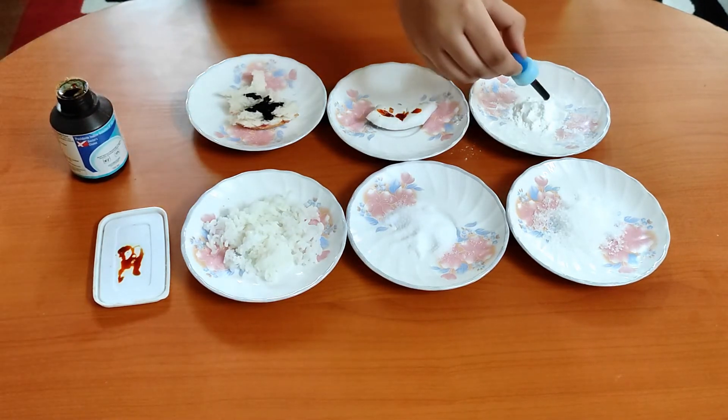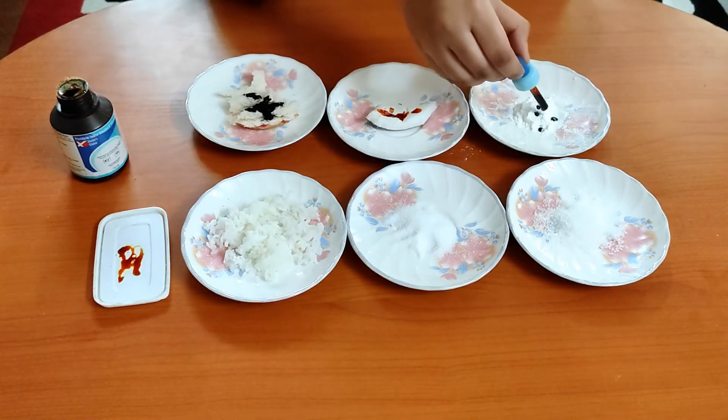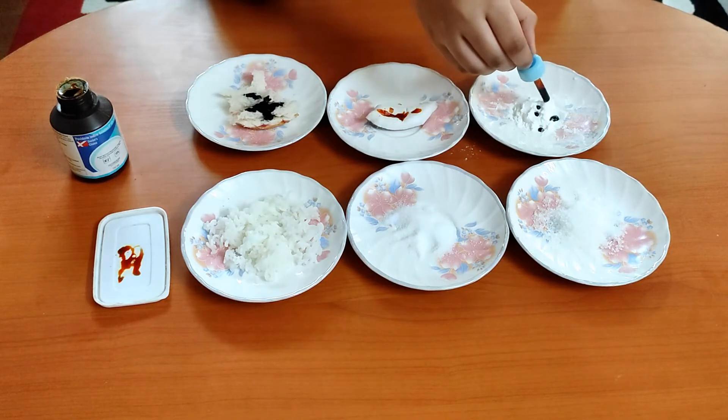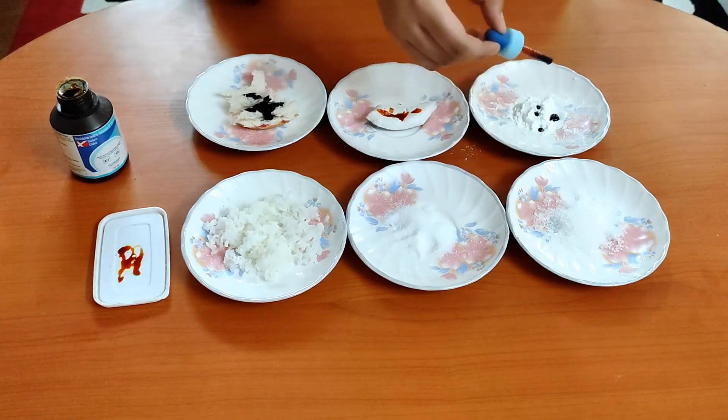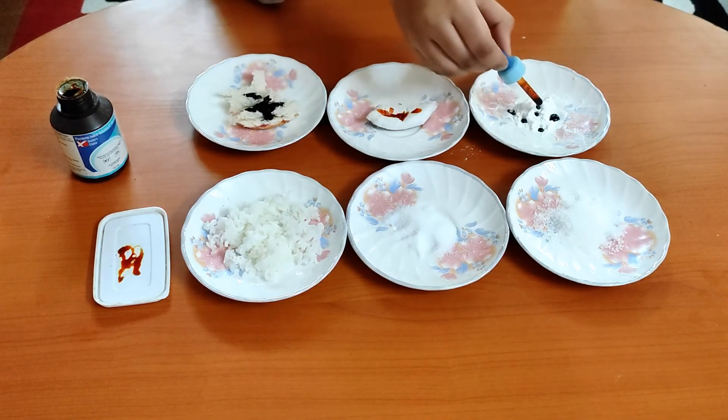Now we will put iodine on cornstarch powder. The color changes to bluish black, which means cornstarch has starch.